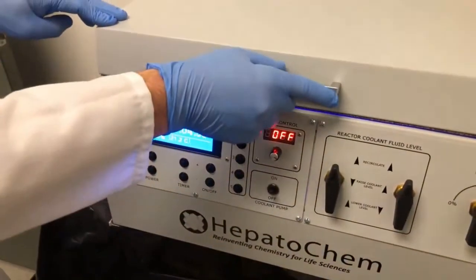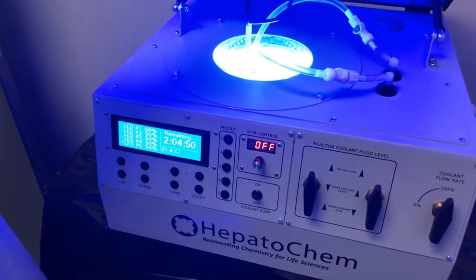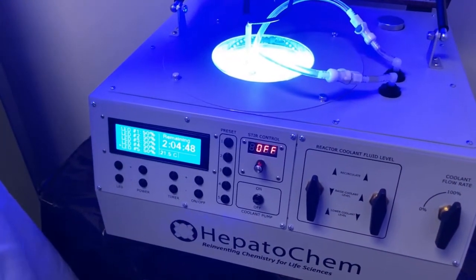We'll take a quick peek to show it's working, but please be sure to leave the lid closed while the reaction is underway, and please don't forget to wear your safety glasses.